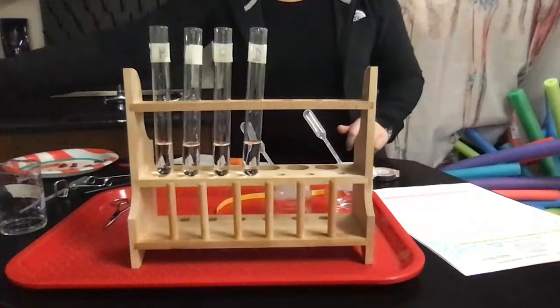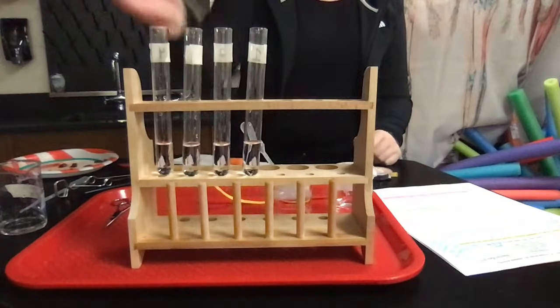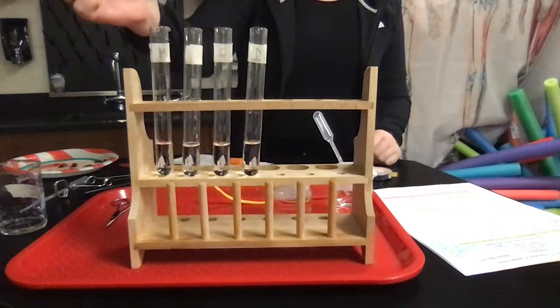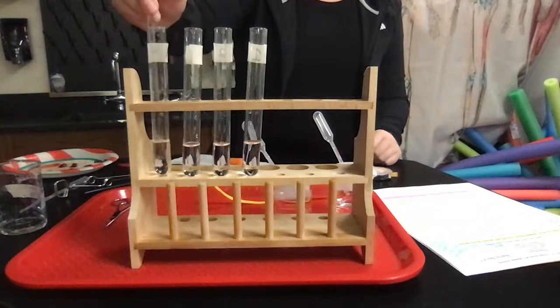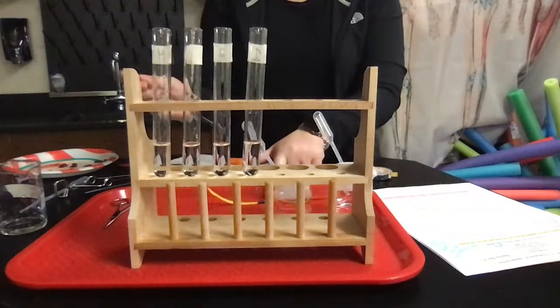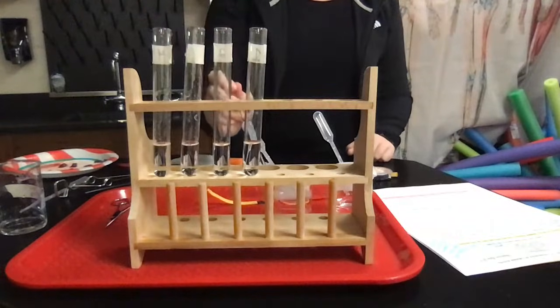And then let's see, it looks like I have a pretty strong acid and a pretty strong base. Let's see if I can get number 4 to be an in-between. So what if I add a bunch of acid and like 1, oops, that did not mix. Let's see if we can stir that together. And like a drop of base. Let's see what happens there. That one is even more basic than it was before. Let me go back and check 3 again. Okay, so those are about the same.